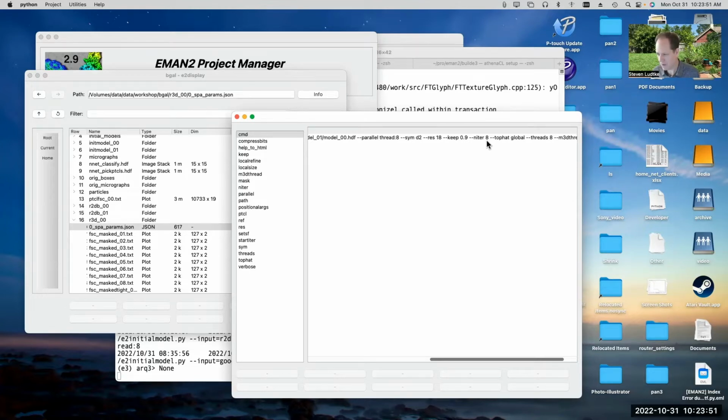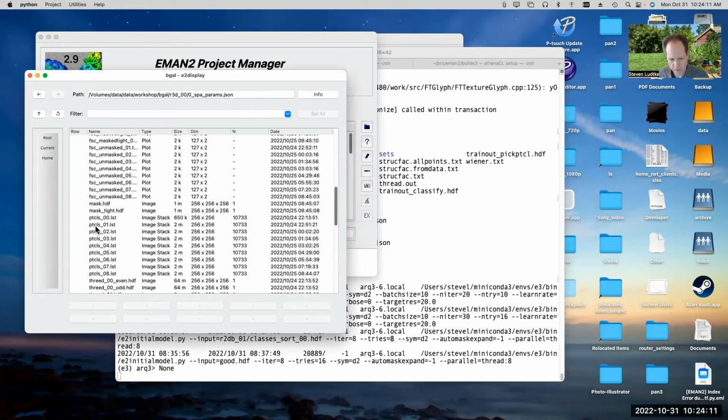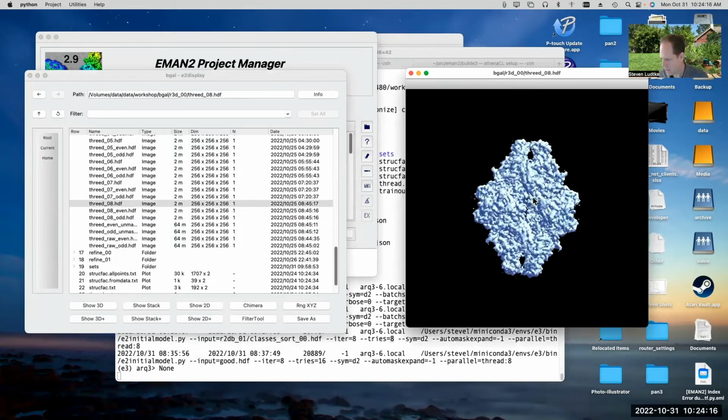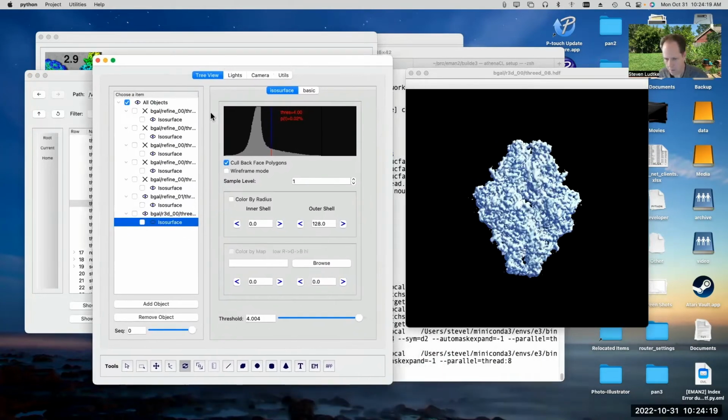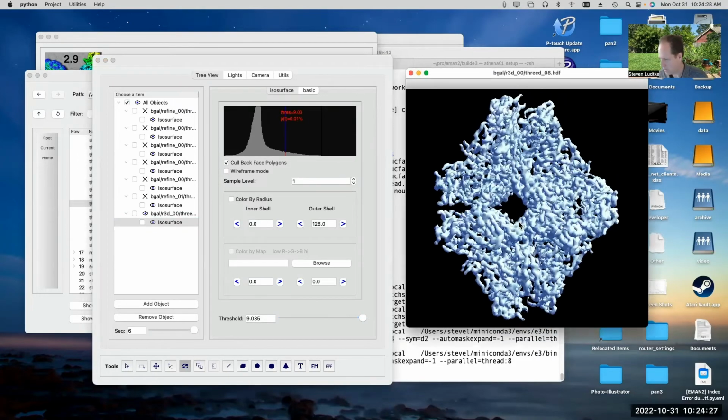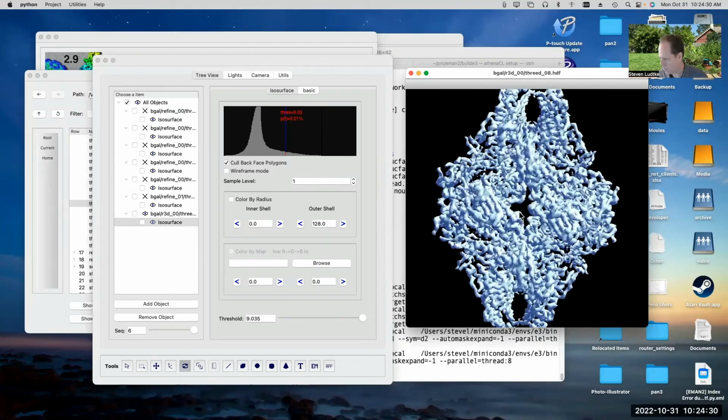The amount of time that it takes to run is pretty comparable to doing the high resolution refinements over there. We can look at that. It can take longer, it can take less time. It depends on the particular project, but it generally tends to produce nicer answers. So let's take a look at the results of this. 3D08. Oh, hang on, let's see. Oh, sorry, I've got them all loaded here again. There we go. So you can look at this.